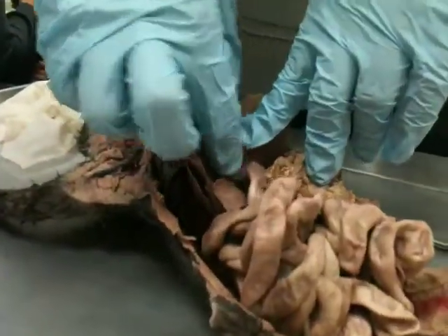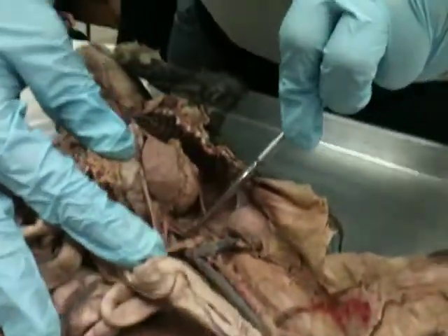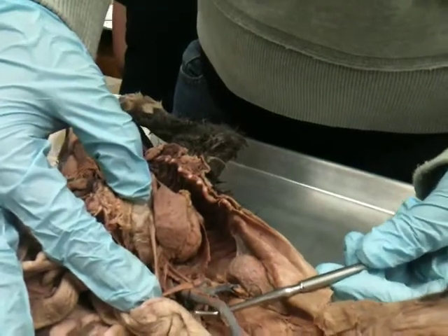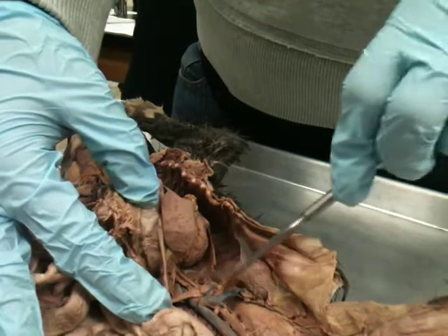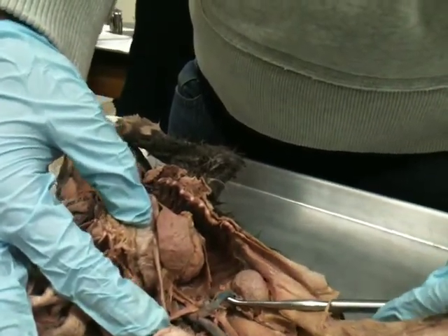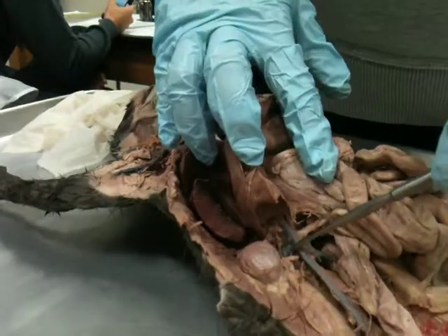Okay, and then so there's all this tissue kind of where that inferior vena cava comes back together, and we can see it if we move all the intestines out of the way. So there it is right here. What is it? The inferior vena cava reforms after the liver. And then you can see there's a branch going to the kidneys on either side. So this branch is on the left side, so it's the what? Left renal vein. Left renal. So renal refers to the kidney. So left renal vein, and then we also have a right renal vein. You can see it right there.